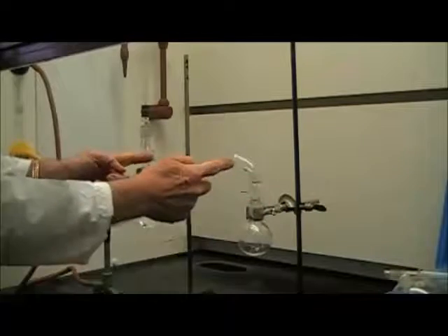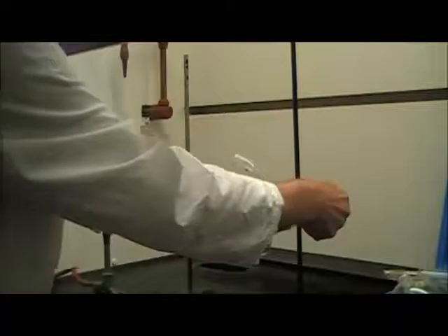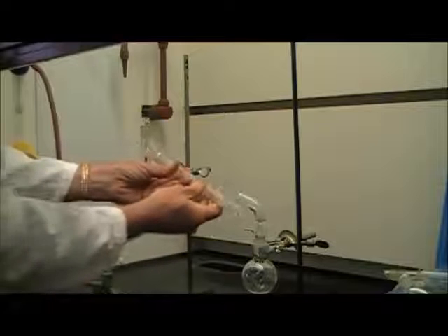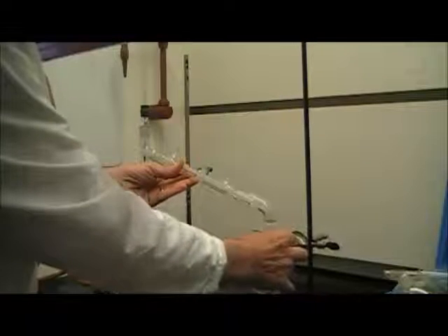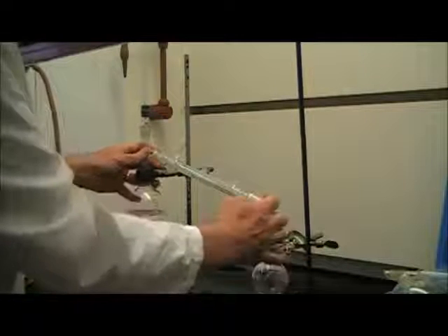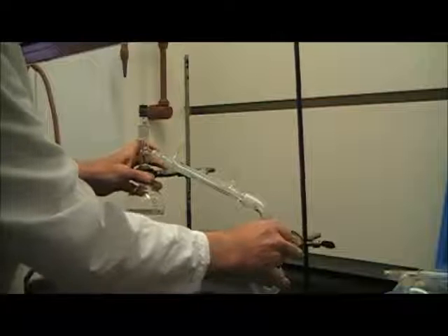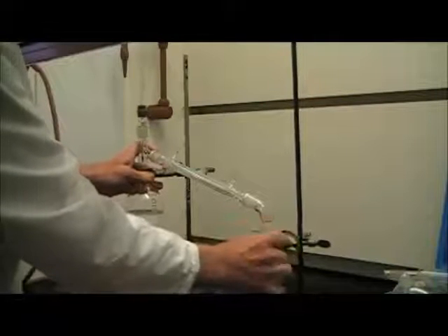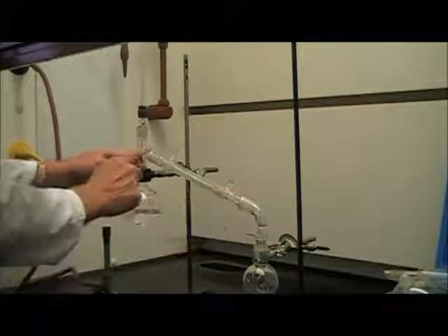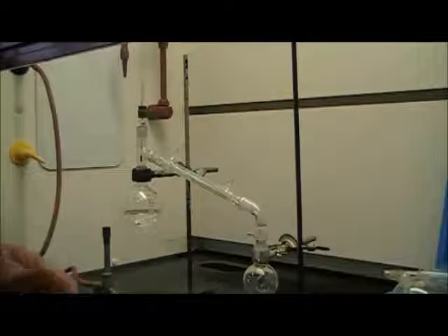Now, these aren't going to match up, so I'm going to have to lower one or raise the other one. I can attach my condenser in the middle. I may have to raise or lower one or the other. I may have to change the angles at which they're situated. The idea is we need to make sure that all the joints are tight and all of the places where the glassware is joined so that no vapors escape.